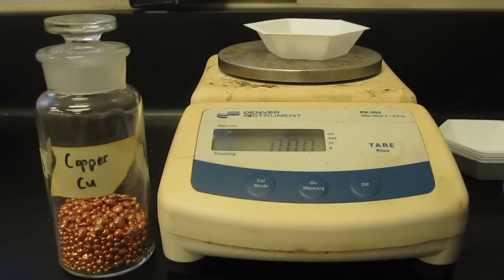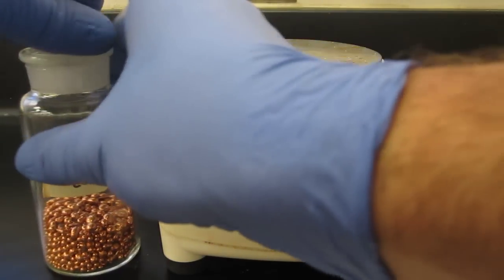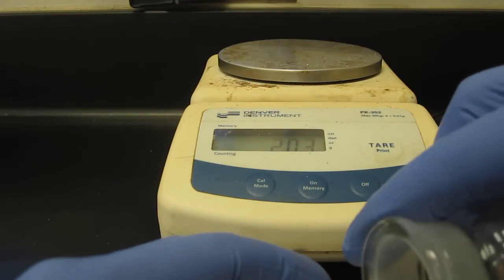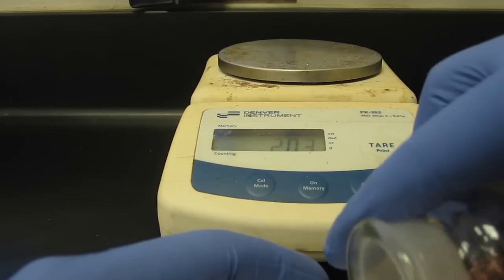But anyways, let's tare this, okay, so it's at zero now. So, take our copper shot and we're going to just throw a couple in there, a few I guess.